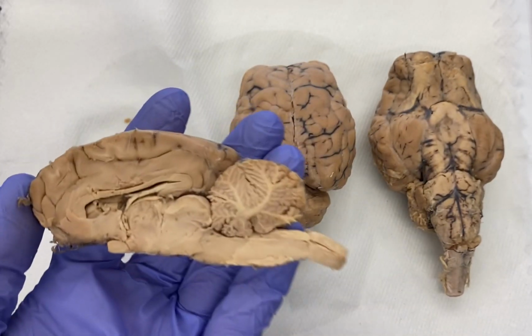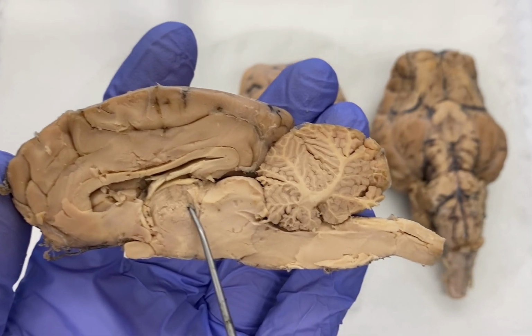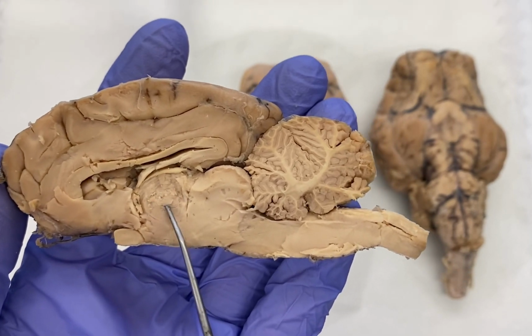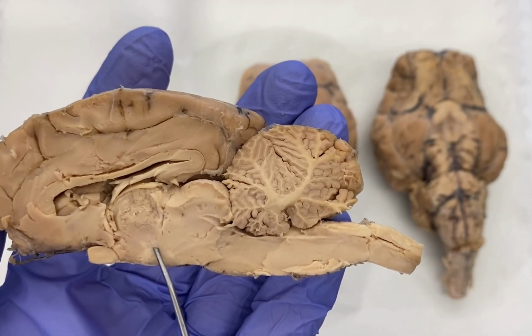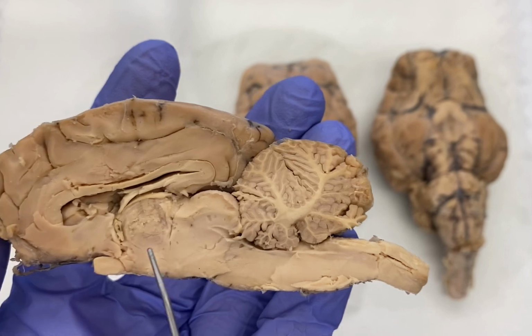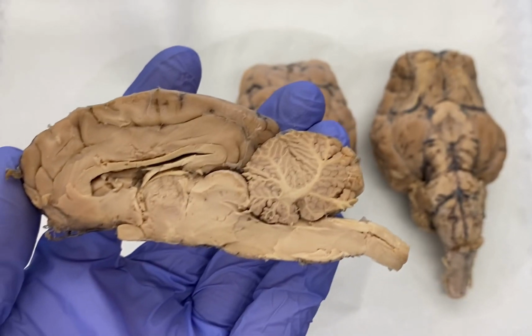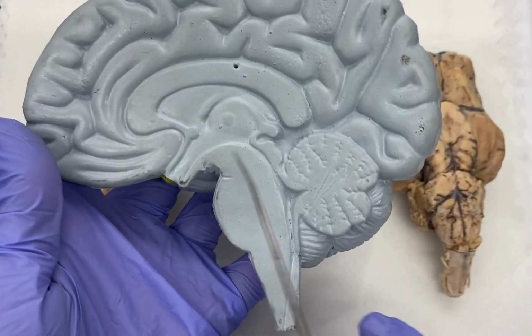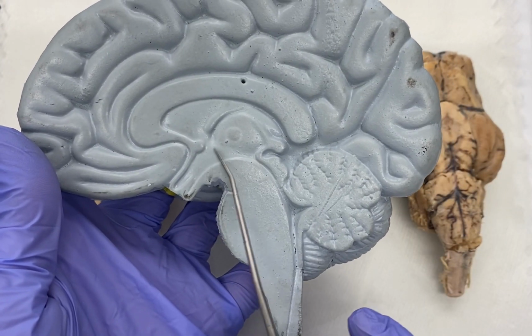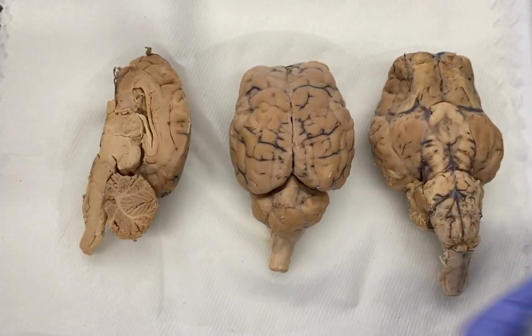If you move just below the thalamus, you move to something called the hypothalamus. And that should make sense, it's below the thalamus. So the thalamus, hypothalamus. On our human brain, that region would be this general region all in here. So here's our thalamus, and below it, all this is our hypothalamus.